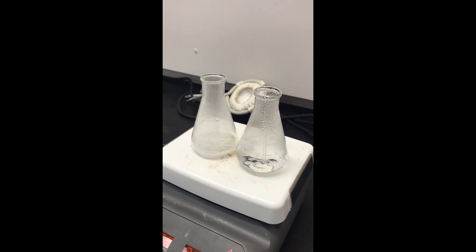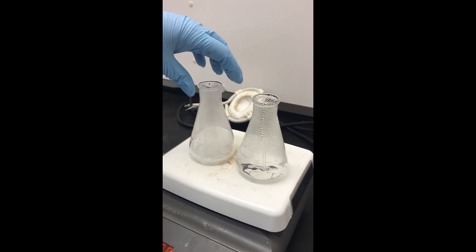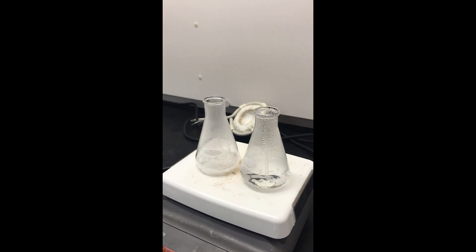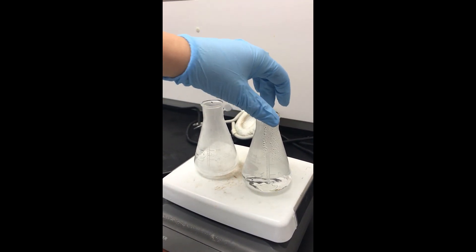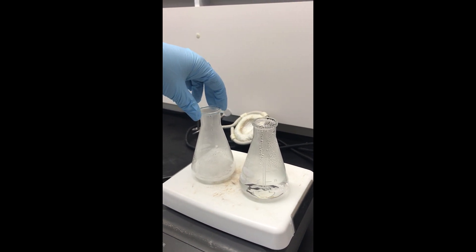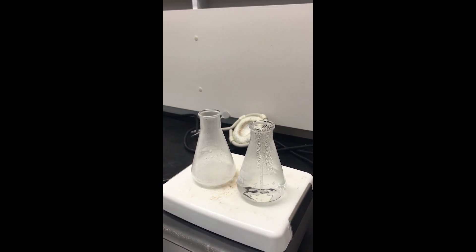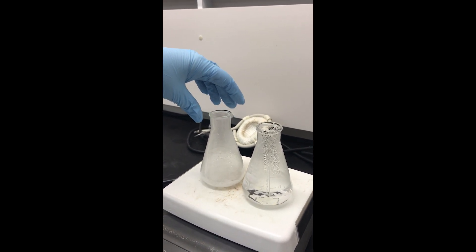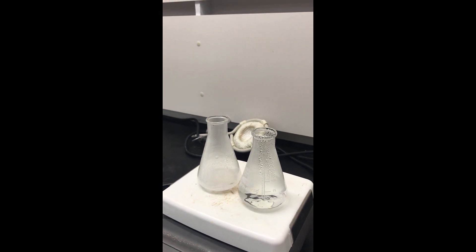Make sure to keep that water hot. As this gets back up to boiling temperature, some of the water will leave, so the amount of water that we added is not going to be the exact amount necessary to dissolve it because there's some evaporation going on. Once I see that this is actually boiling and I still have solid in there, I can keep adding more water.